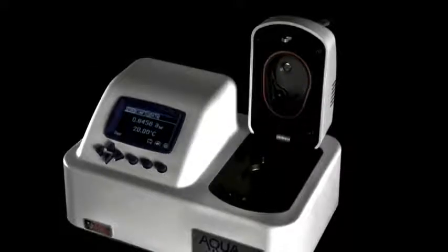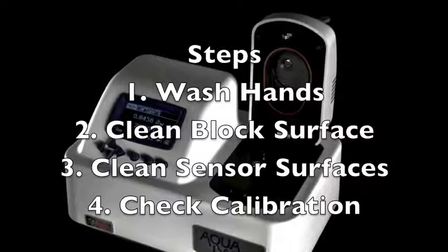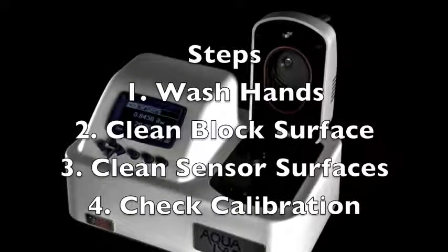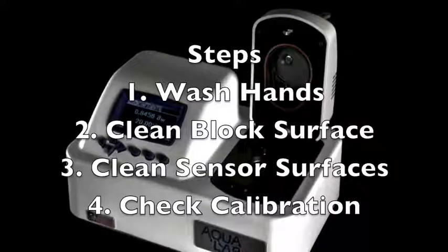Cleaning your Aqualab involves four basic steps. First, wash your hands. Second, clean block surface. Third, clean sensor surfaces. And fourth, check calibration.